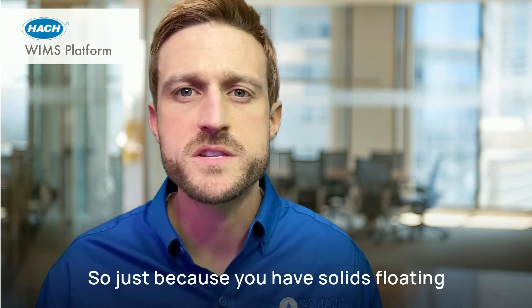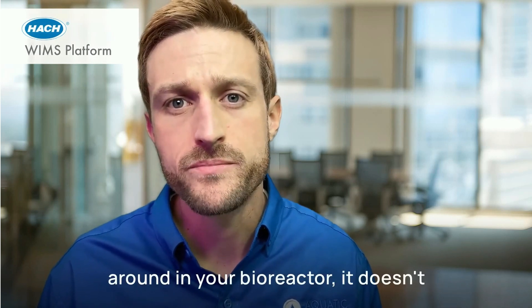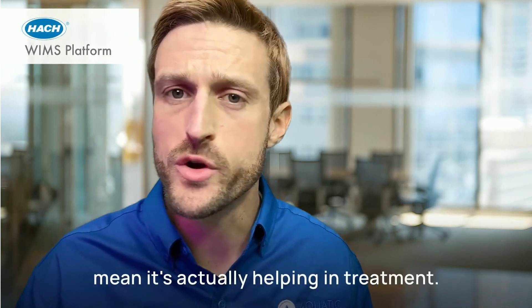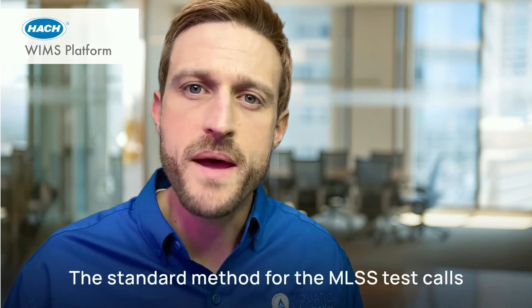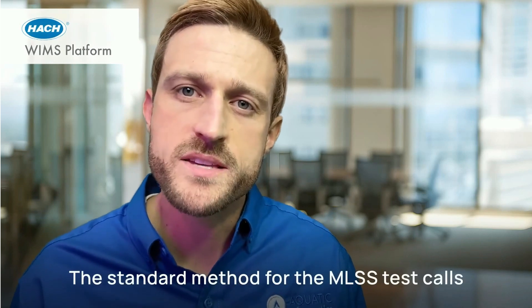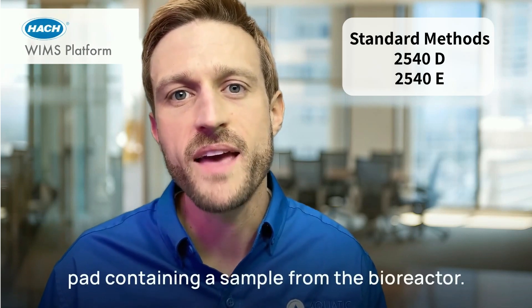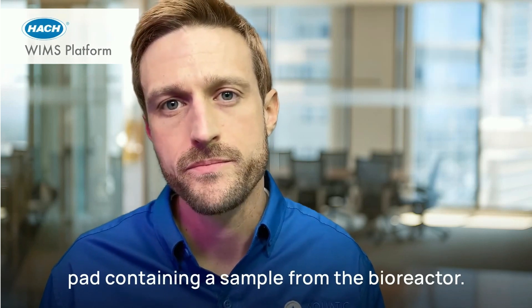So, just because you have solids floating around in your bioreactor, it doesn't mean it's actually helping in treatment. The standard method for the MLSS test calls for drying and carefully weighing a filter pad containing a sample from the bioreactor.